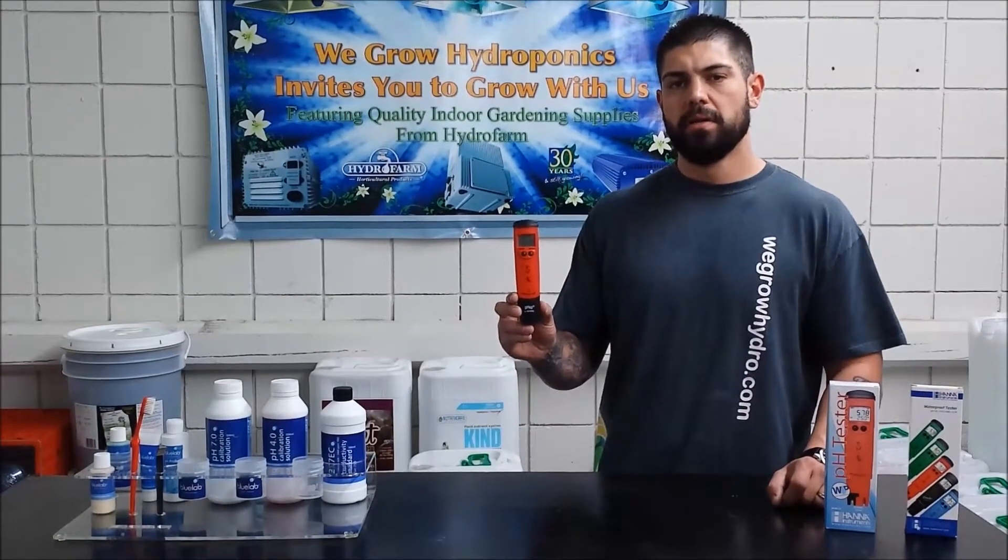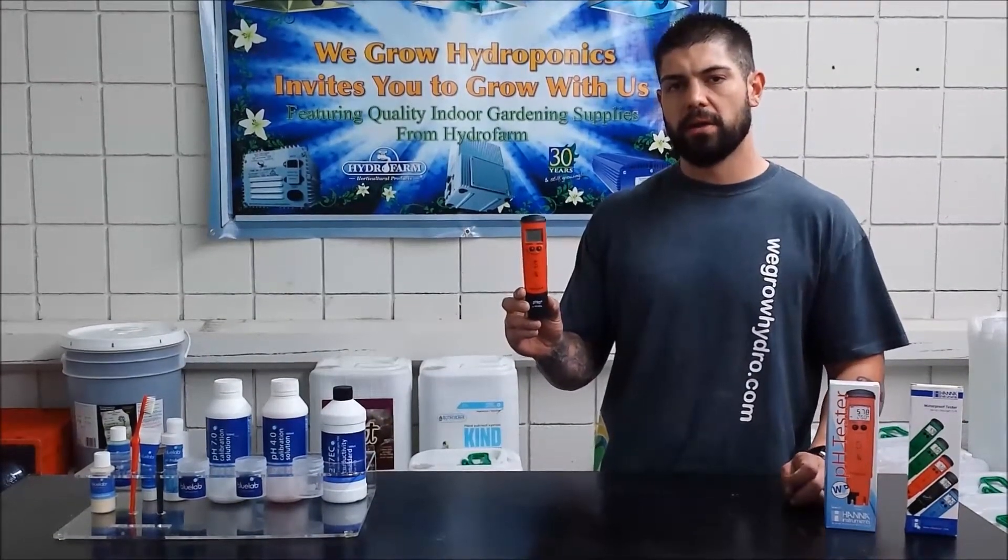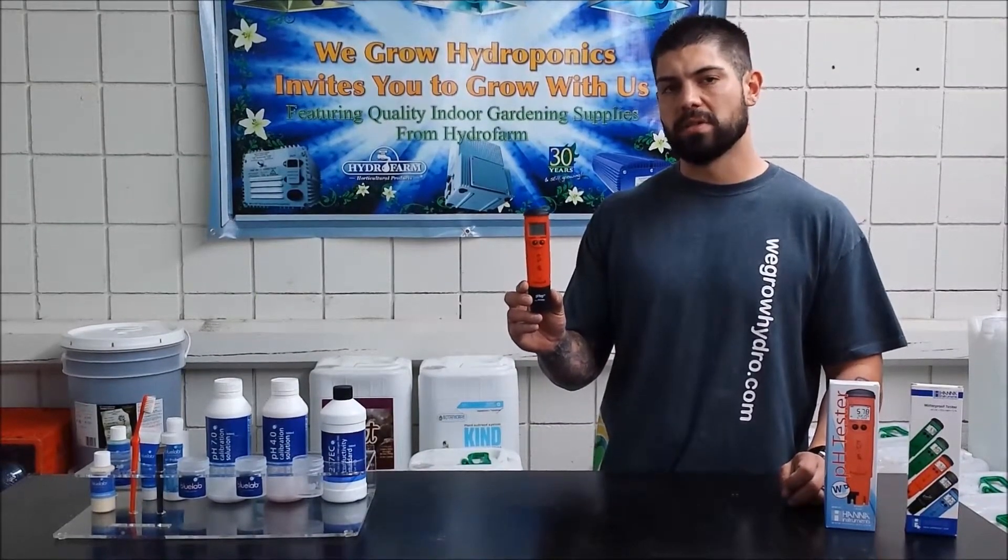Hi everybody, Paul here from WeGrow Hydro. Today we're going to show you the proper way to calibrate your Hanna pH Tester HI98127.